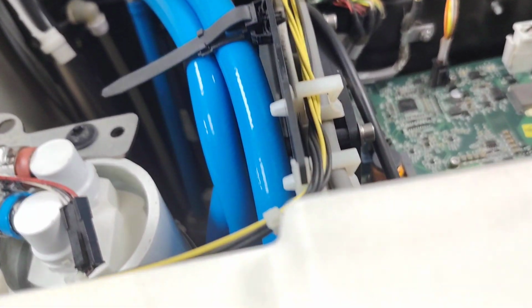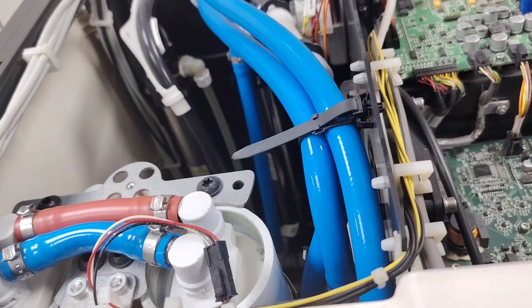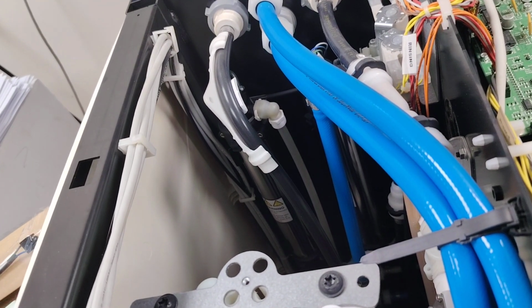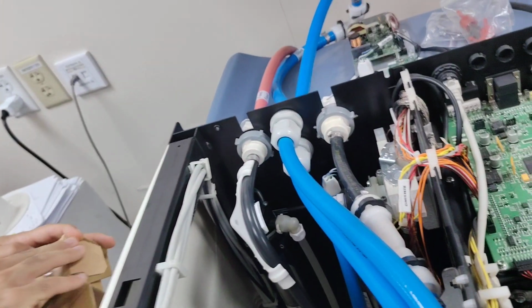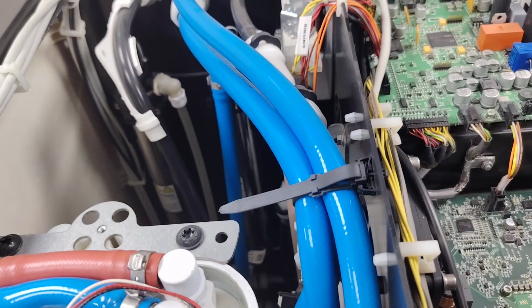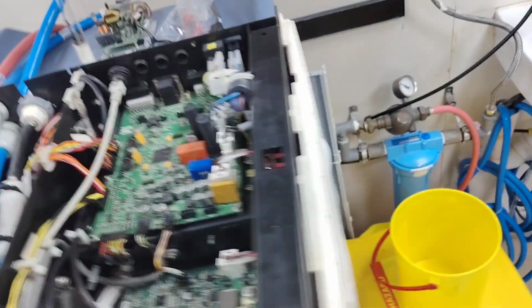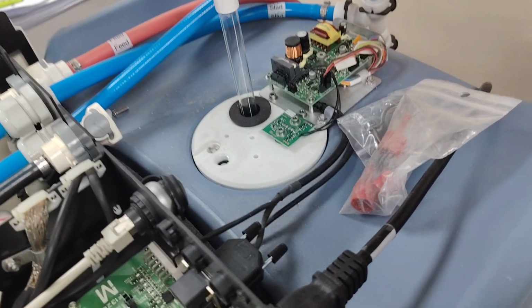You need to power off already. Yeah, turn off. Need to remove power. There's no real electrical connection there you were going to touch. Already damaged, huh? See, black already.